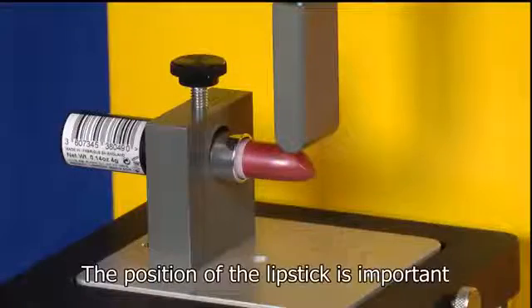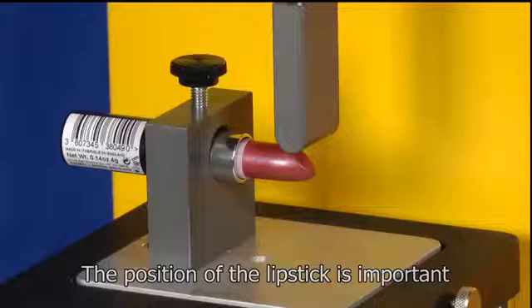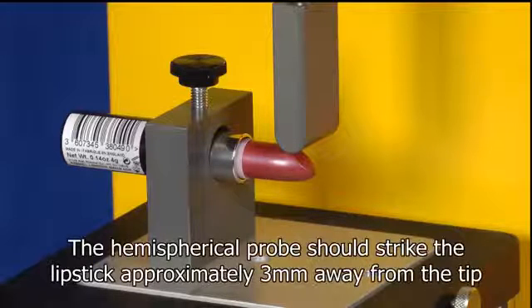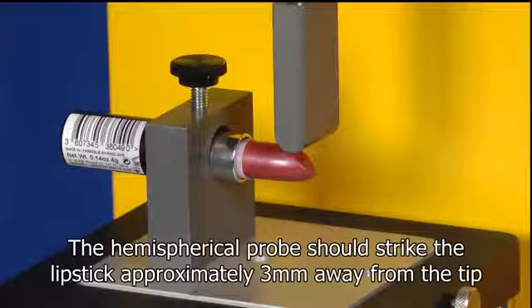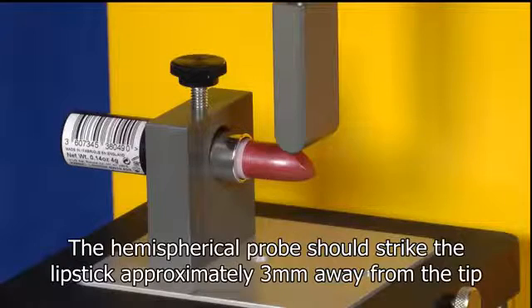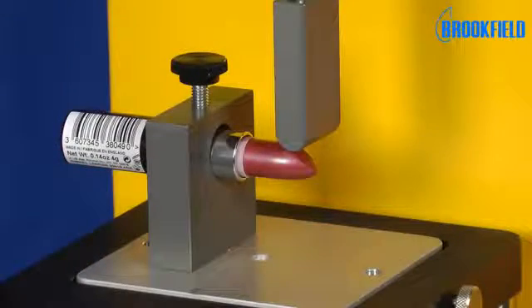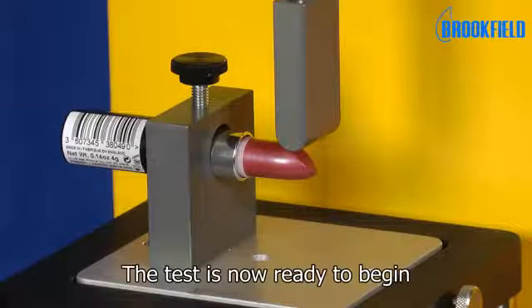The position of the lipstick is important. The hemispherical probe should strike the lipstick approximately three millimeters away from the tip. The test is now ready to begin.